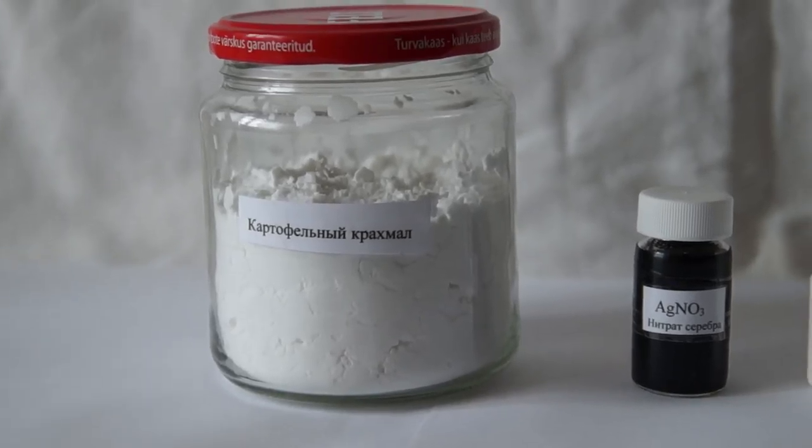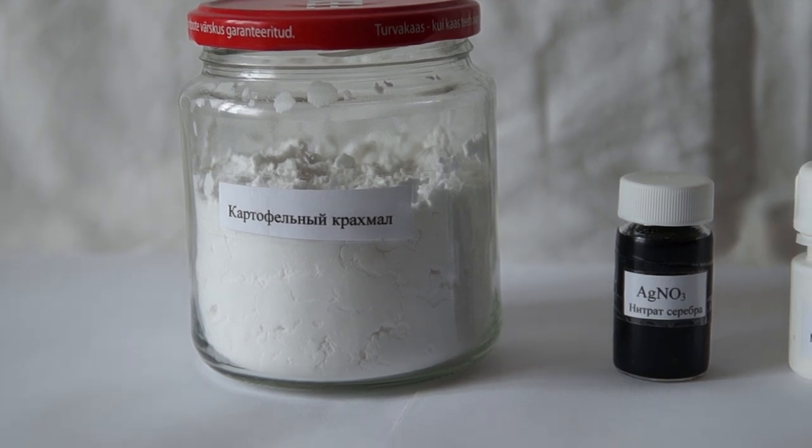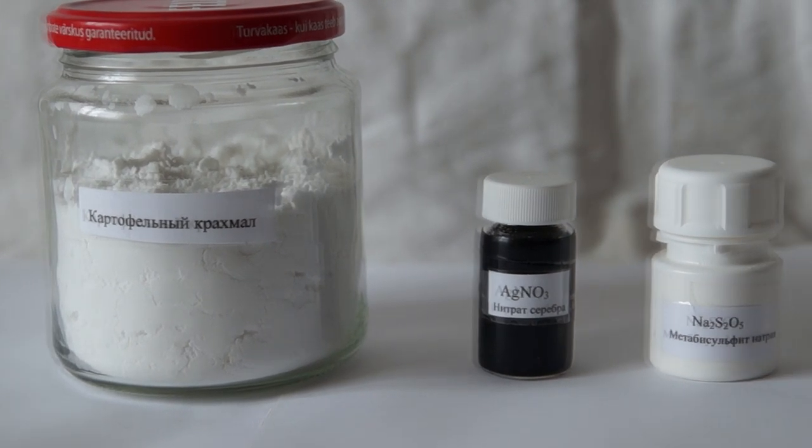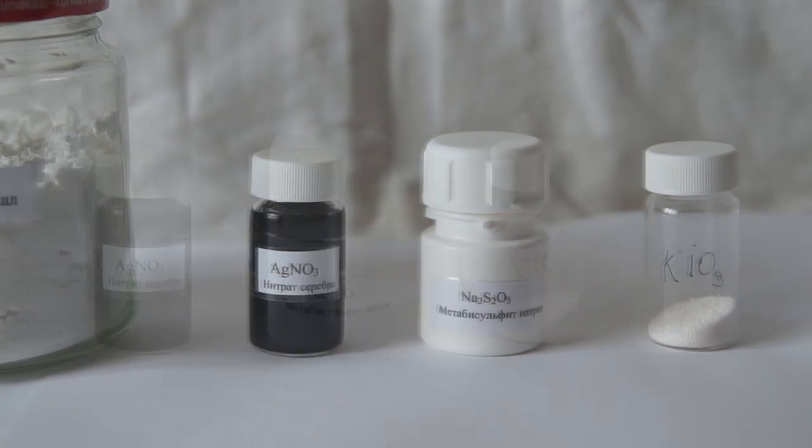Hello everyone! Today we will conduct a very beautiful experiment, which I like to call the irrepressible solution or a chemical silver clock.